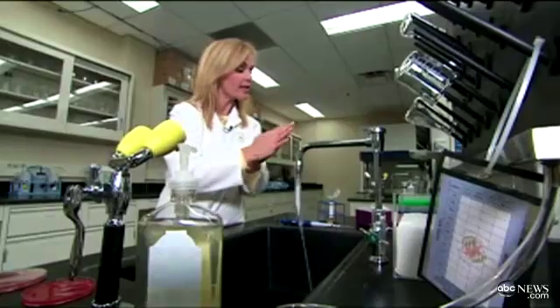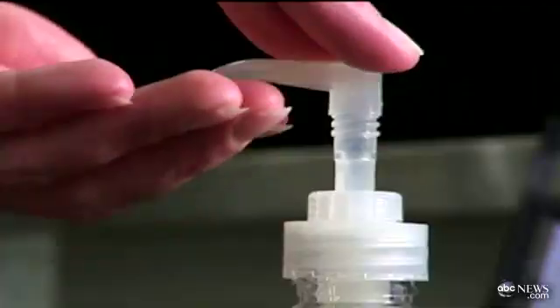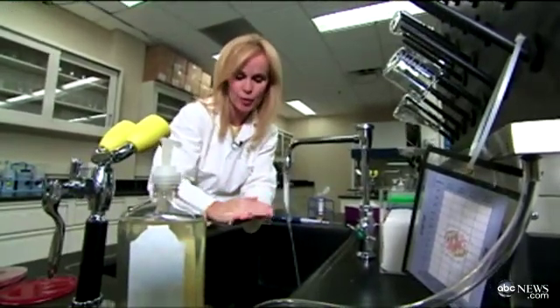And finally, I rub my hands on this Petri dish. Next, I repeat the entire process with the E. coli, only this time I use soap and lather for the entire 20 seconds that experts recommend.